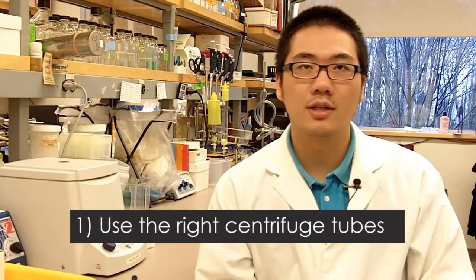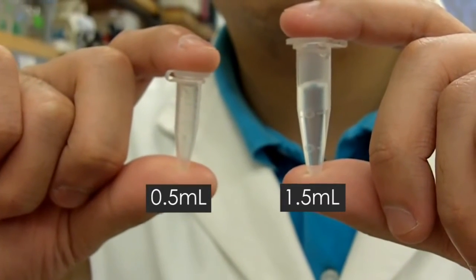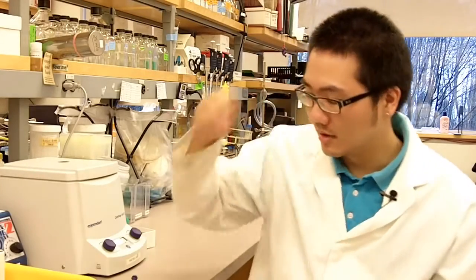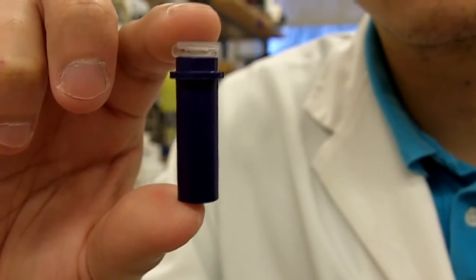The first thing you need to know when you use a centrifuge is to make sure you use the right size of tube for the right centrifuge. Here is a commonly used 1.5 mL microfuge tube that fits in most of the tabletop centrifuges. Here is a 0.5 mL microfuge tube that would also fit into the centrifuge. But if you use this one, you'll have to use an adapter. So you place it in an adapter like that and use it. If you don't, the tube might break.